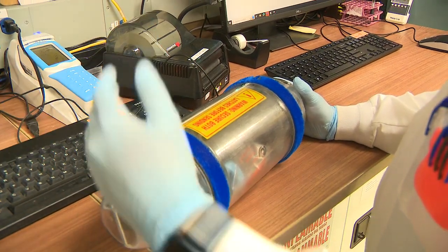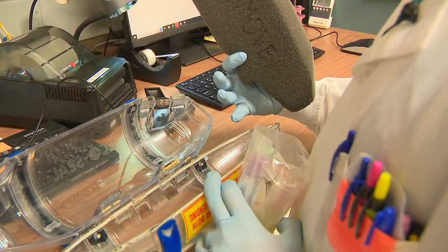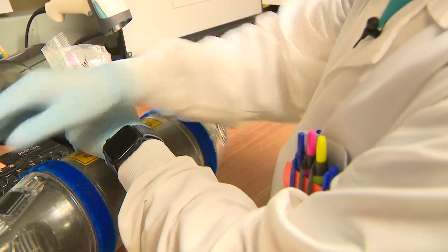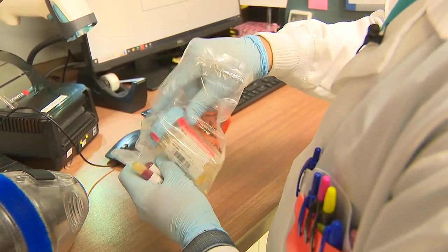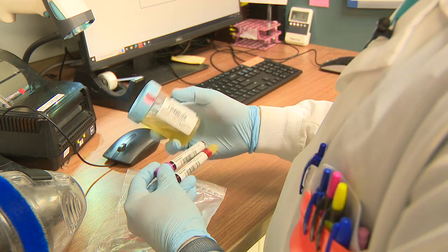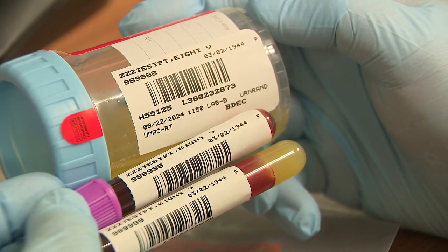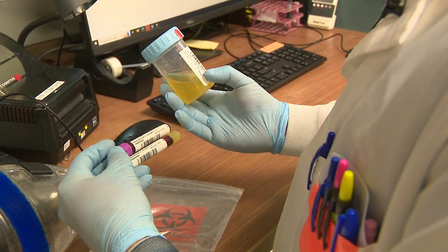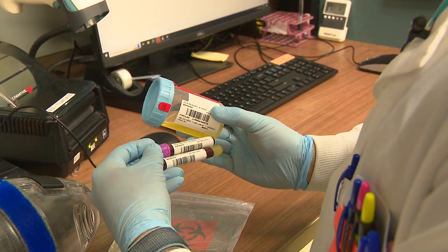We've just taken the sample from the tube station. I'm opening up the tube, taking out the specimens, and verifying that there isn't anything else hidden underneath this foam protector pad that's used to help specimens not jostle around inside the tube. So these will come down double bagged. What I'm going to do now is take out all the specimens and verify that it's the same patient for all the specimens. We never want to have two different patients in the same bag, so we're verifying that all the names and stickers are the same patient. If we have different patients in the same bag, that has to be rejected — that's for safety purposes, because you never know if there's been a mix up between patients. So anything in the same bag has to be from the same patient.